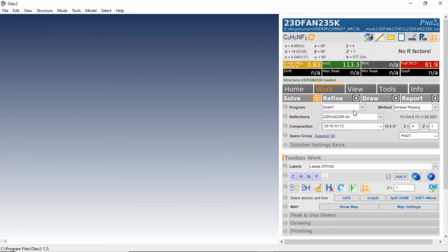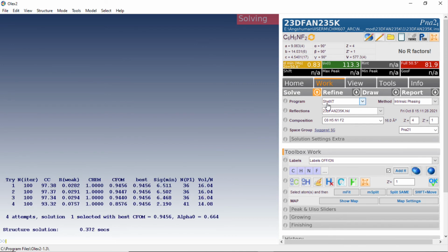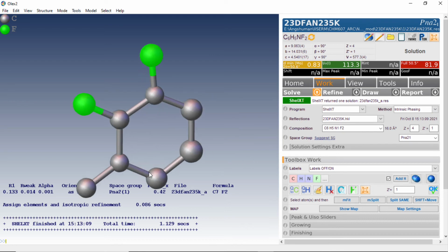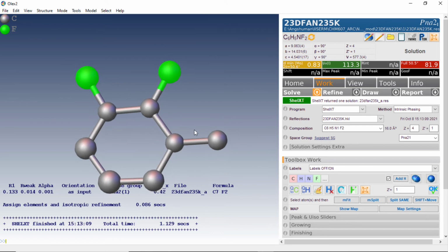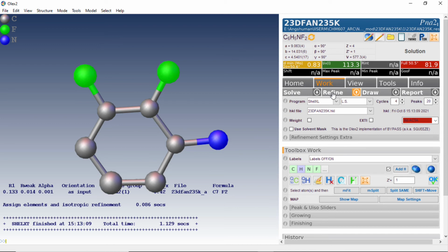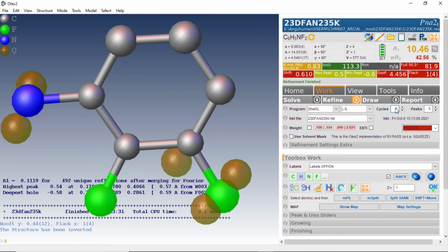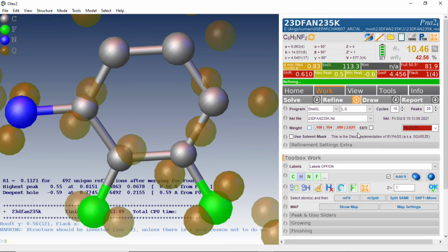Under solve, we have the standard modules and we click solve. So it uses SHELXT, which is the method of intrinsic phasing, and tries to give you the structure solution. You see, in less than 1 second, it has given us the structure. One can identify that as nitrogen, and we try to refine it. One should actually increase the number of cycles to 10 and number of peaks to about 20 and say refine, with the weight factor being refined continuously.